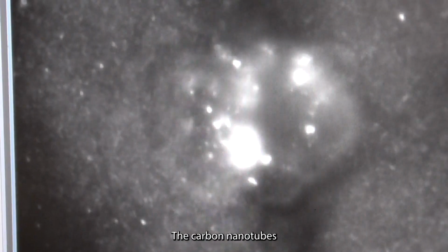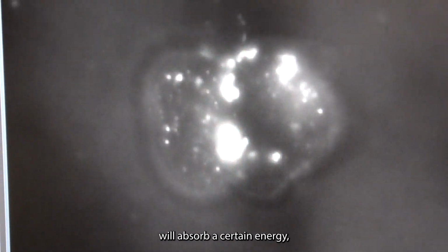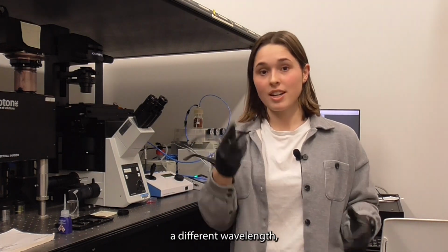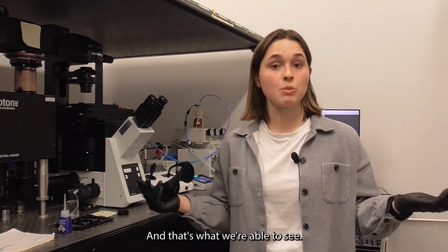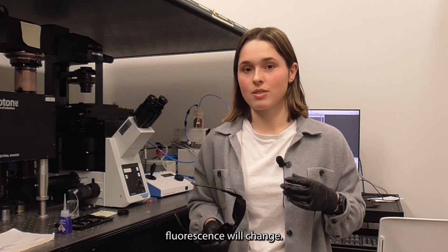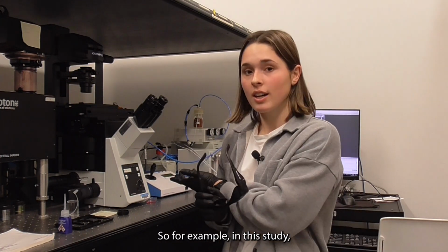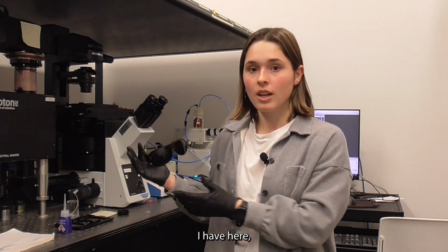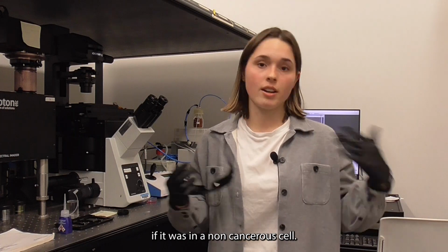The carbon nanotubes and other fluorescent particles will absorb a certain energy, a certain wavelength of light, and then emit a different wavelength, a different energy of light, and that's what we're able to see. Depending on the environment, a carbon nanotube's fluorescence will change. So for example, in this study, I can expect that working in a cancer cell, like the breast cancer cell I have here, the fluorescence will look different than if it was in a non-cancerous cell.